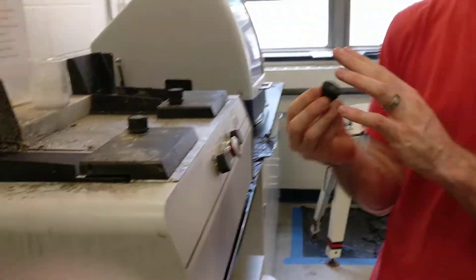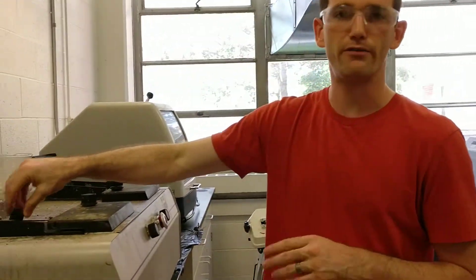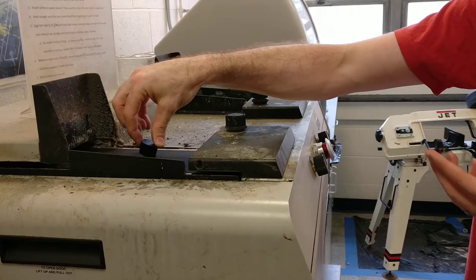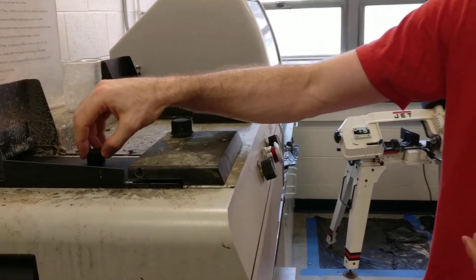Often, like beginners, sophomores will create facets in their samples by allowing the front to have friction and get pulled down. So we'll only do that for a short period of time.